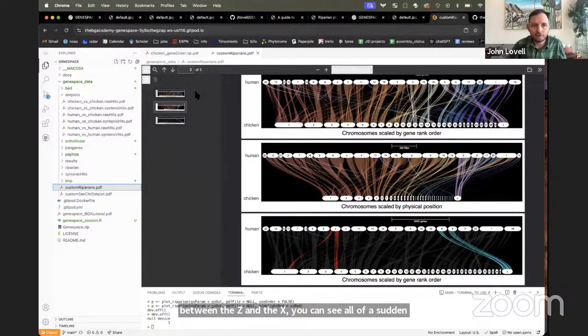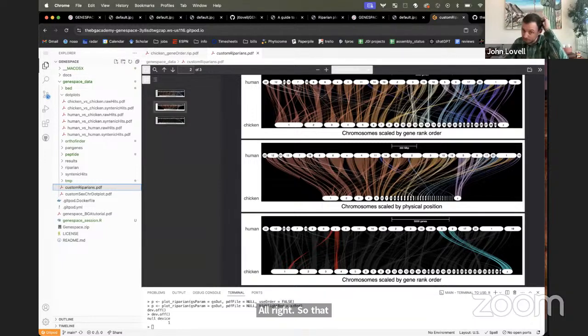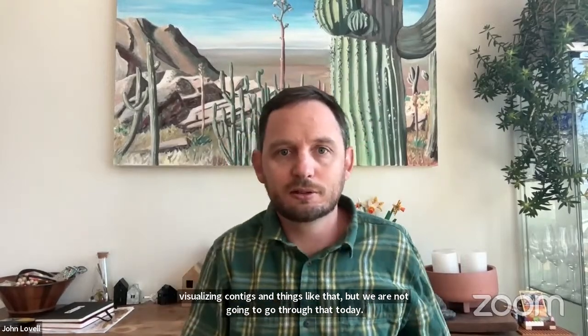All right, so that is it. That is the full tutorial that I have planned for today. There are other functionalities for GENESPACE, including quality control of your genomes and visualizing contigs and things like that, but we are not going to go through that today. All right, so any questions or maybe issues getting it going?